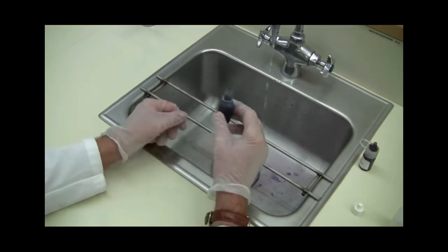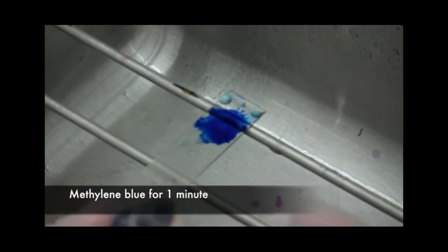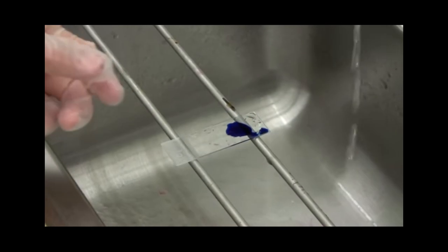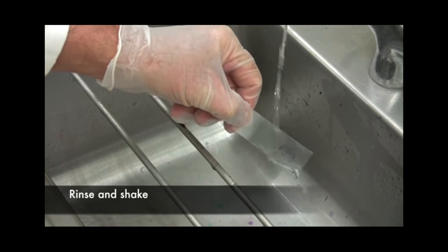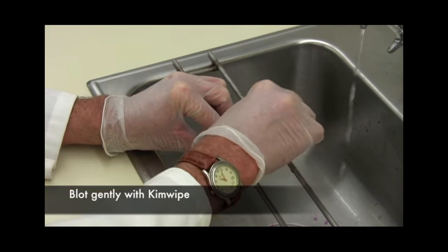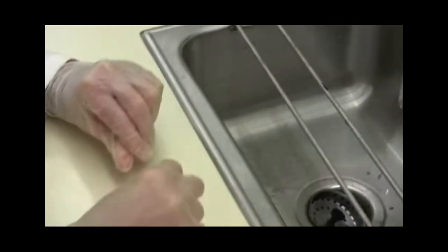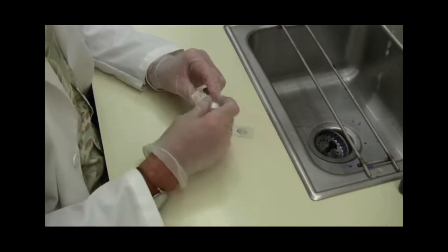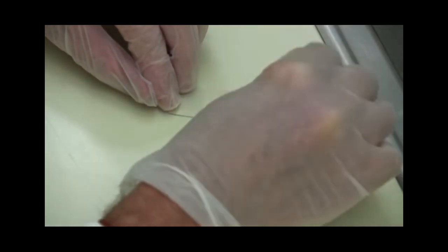Wash again in tap water and counterstain in methylene blue or acetified methylene blue for 3 minutes — though sometimes others do it for 5 to 10 seconds, in the laboratory we use 3 minutes. Follow with bluing using tap water. Blot dry and complete drying in an oven, or wipe using gauze. The section is then ready for clearing using xylene and mounting.